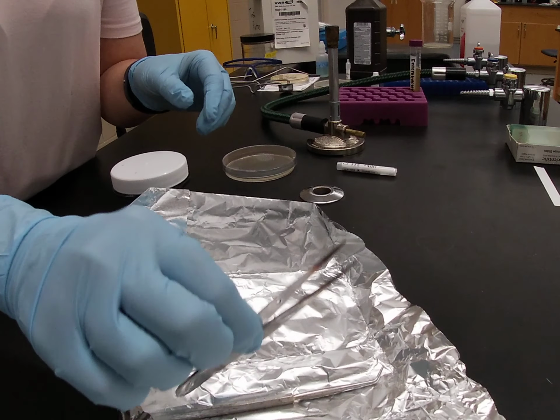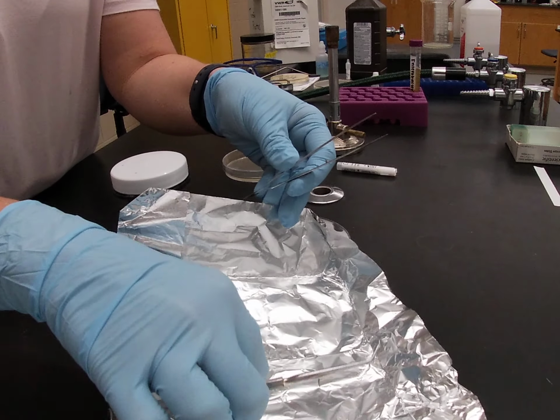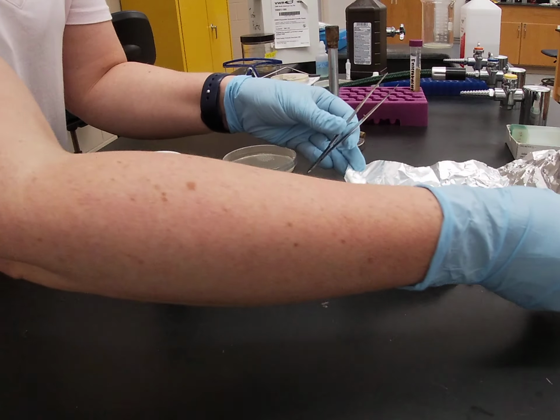Inside your packet, you'll have two pieces of equipment. You'll have a pair of forceps, and you will have a blunt-ended probe. Let's keep these off to the side.